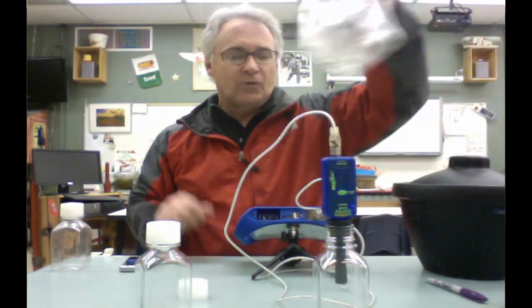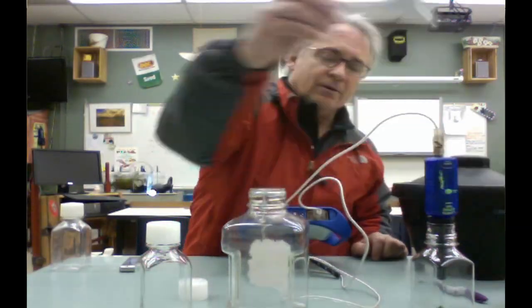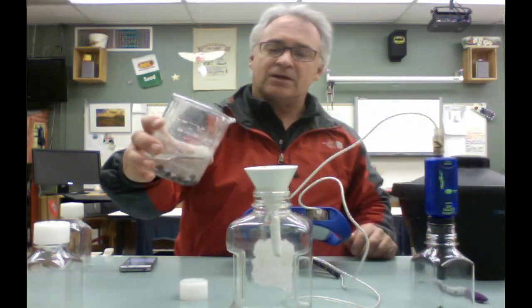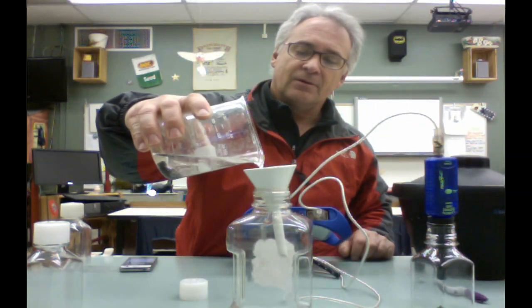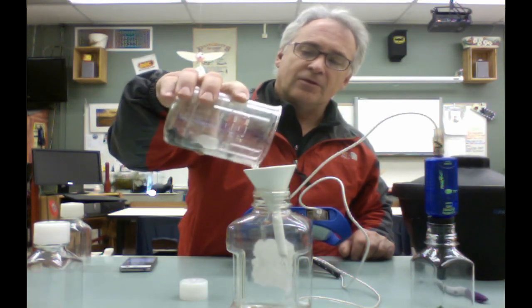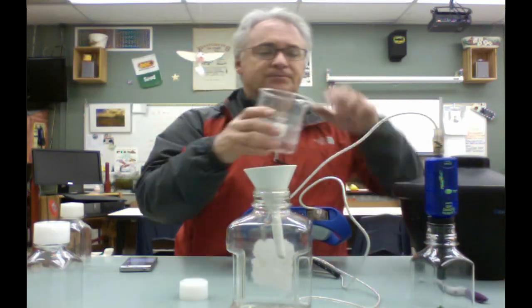While that's cooking and collecting data, you can start getting your next sample ready. This one is going to call for water, room temperature water. So you have to pour off some of the water in here. While this is being collected, you're just going to pour the water down here to separate it, and let them drain a little bit.